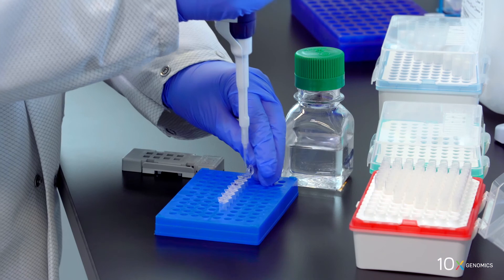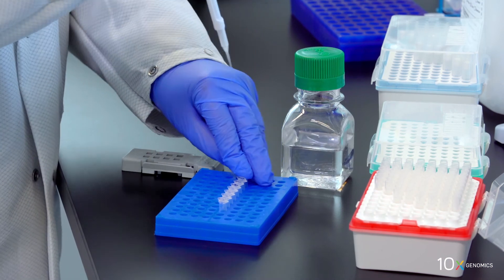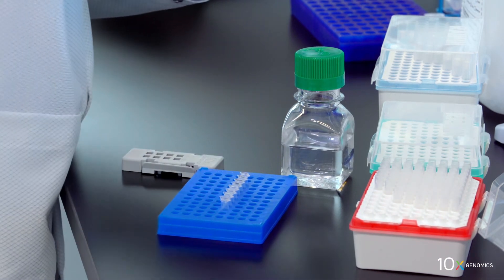We have completed reverse transcription. Next we will perform second strand synthesis and denaturation.